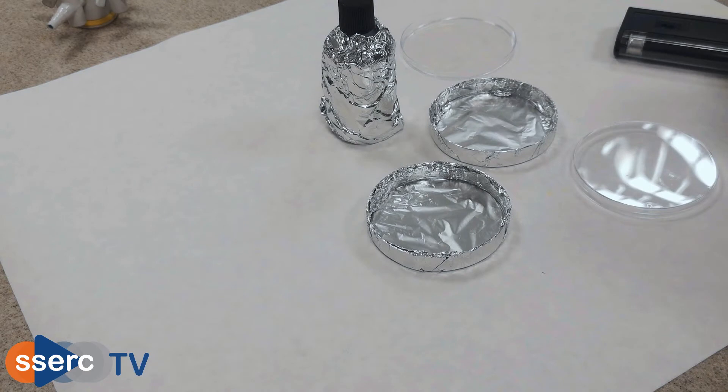In this case I'm just using two petri dishes as a demonstration. You were sent four if you need, but you will need at least two, one as a control. You can also see that I've wrapped the bases of my petri dishes in aluminium foil to prevent any light coming in at the side. This improves results but is not essential.